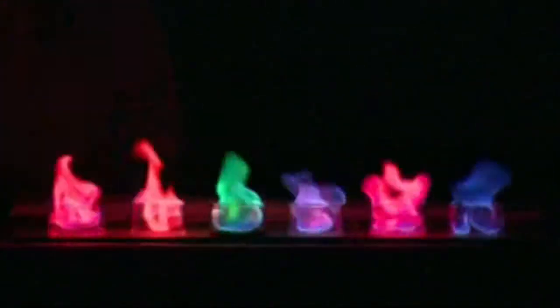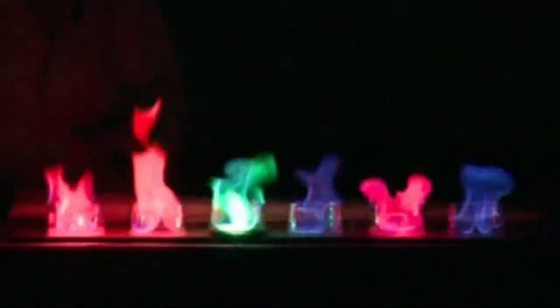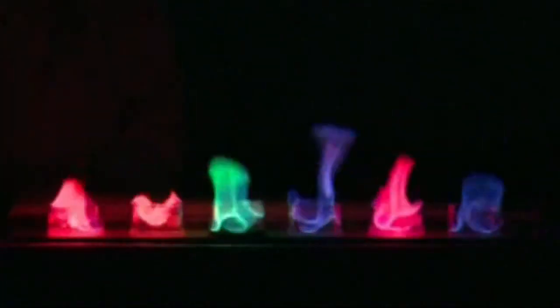They drop back down to the ground state, but when they do that, they have to release that extra energy. And these metals do that in the form of visible light. So that's why we're seeing the flame colours. We see a different flame colour for each metal because there's a very precise energy difference between the ground state and the excited state for each metal. So that's why we see very specific flame colours for each of these metals up here.